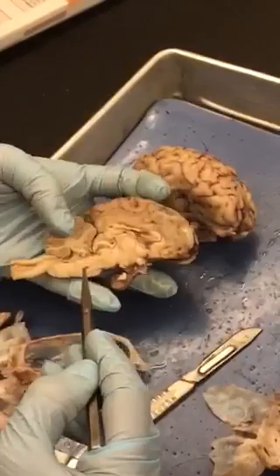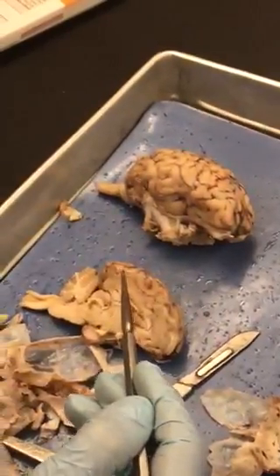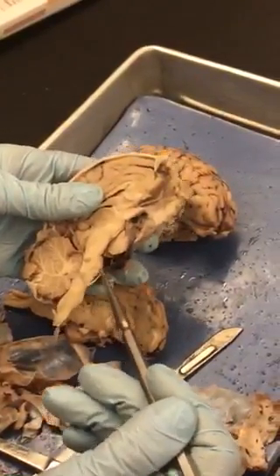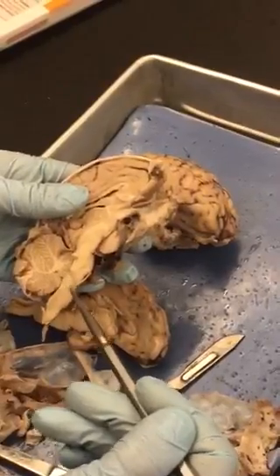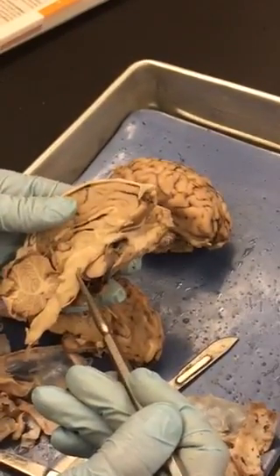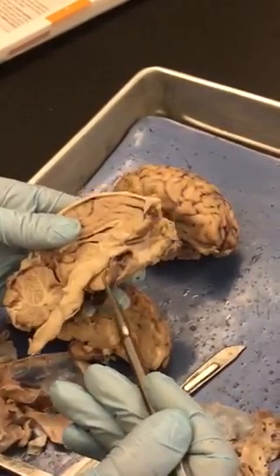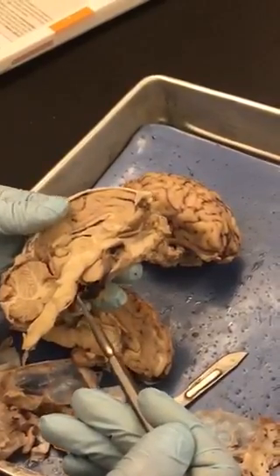And then if you go into the brain stem here, it's not the best. This one's a little bit better. You look for the little belly. If you find the little belly, you have the pons. Go below that, you have the medulla oblongata, and then above it, you have the midbrain. So just go right above it. And then in front of that, this big belly right here is called your mammillary body. You'll have one on either side there.